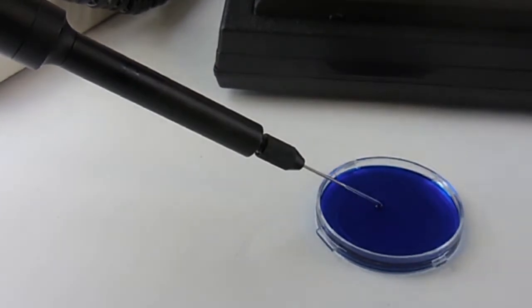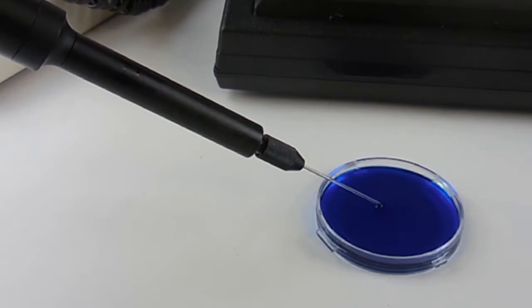The process is called front filling the pipette. Front filling is the term to describe filling a micropipette through the small pulled front end of the pipette. Front filling is achieved by creating a vacuum at the back end of the pipette that pulls the filling liquid into the micropipette.